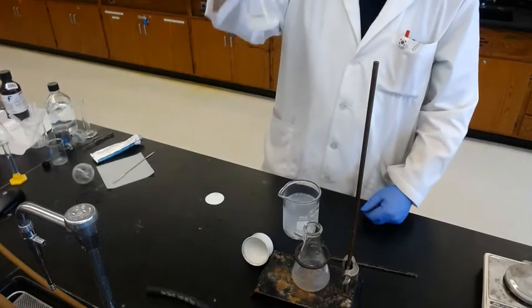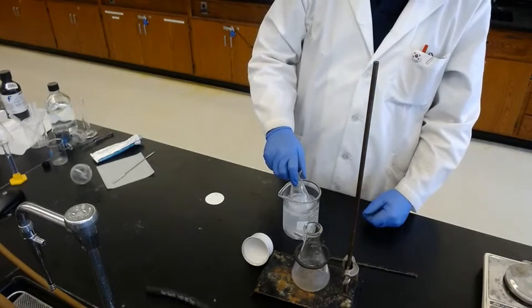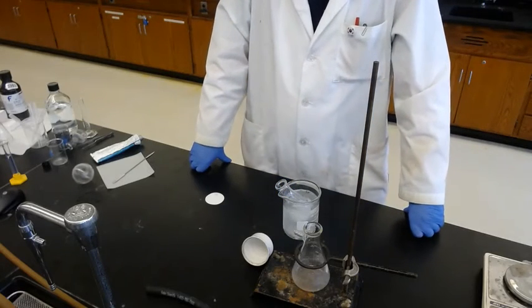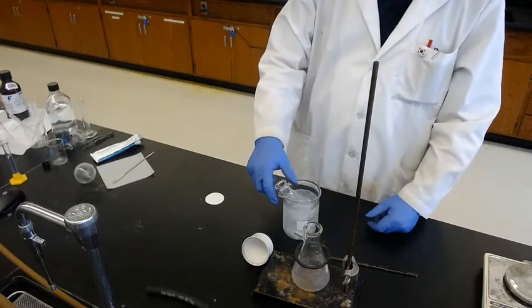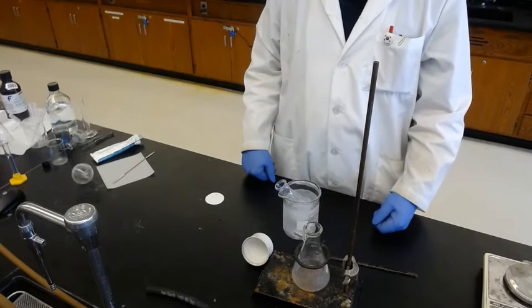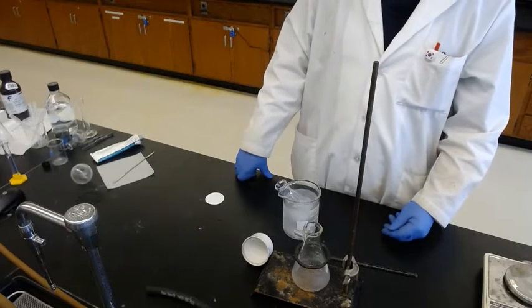Okay, it's crystallized at room temperature, so to precipitate more, we cool it in an ice bath. So more imide compound will be crystallized. When the solid is crystallized, the purity is increased. So one of the good ways to purify solid products to pure form is recrystallization.